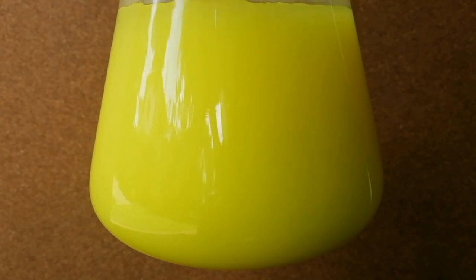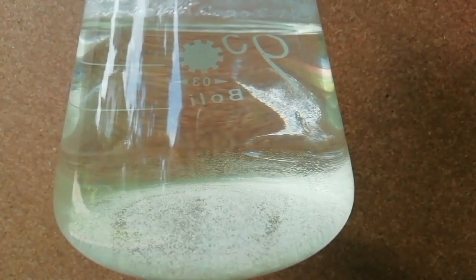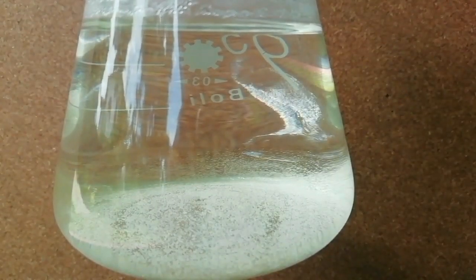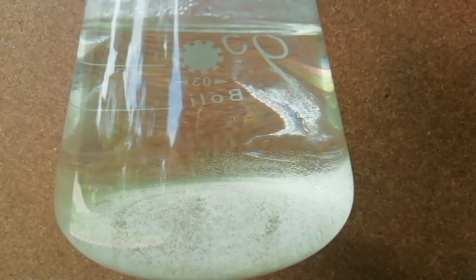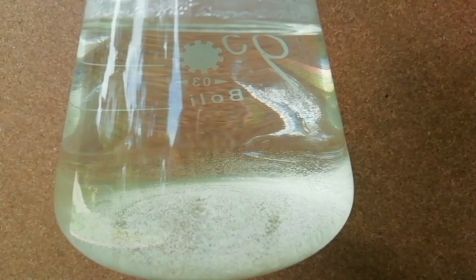After a few minutes, when the solution is clear, let it cool down. Then you can see the formation of lead iodide like gold dust.